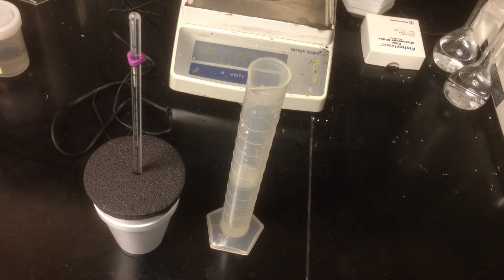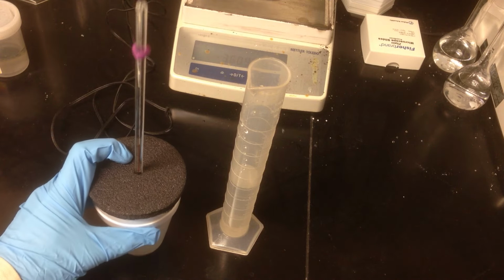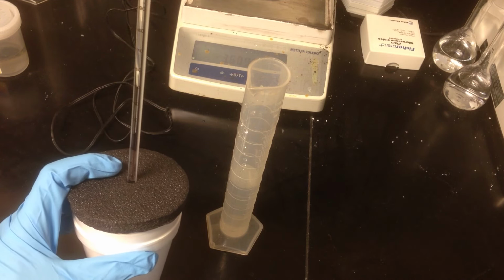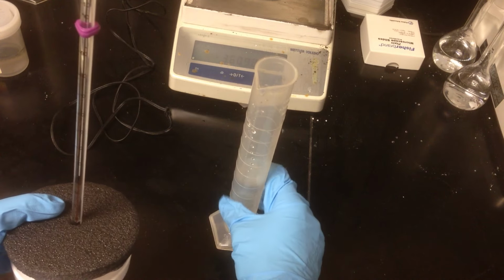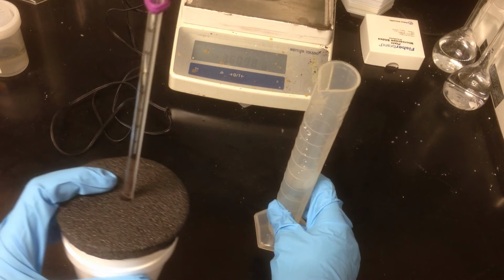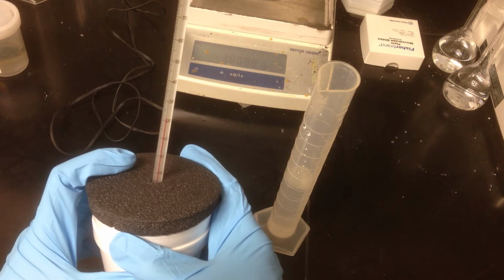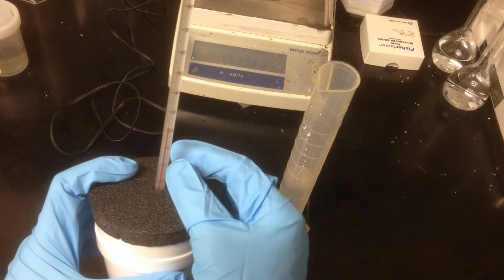Now that we have the calorimeter calibrated, we can actually look at heat transfers and enthalpy changes associated with chemical reactions occurring within. So I have inside the calorimeter now 50 milliliters of a 1.0 mole per liter solution of sodium hydroxide, and in this graduated cylinder I have 50 milliliters of hydrochloric acid. So what we're going to do is mix these two and use the temperature change upon mixing to determine the enthalpy change of the reaction and the molar enthalpy change.